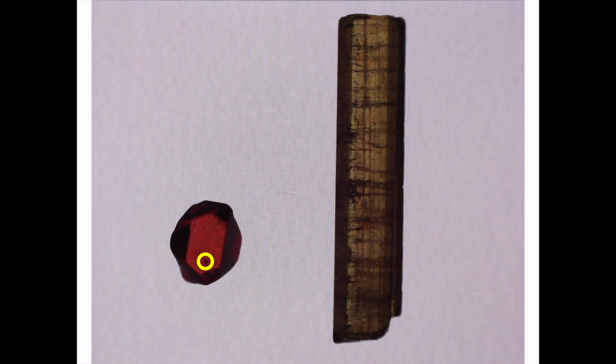So let's see if anything interesting happens when we spin our spinel crystal. And so as we rotate the spinel crystal in this plane, I want you to notice that not really anything's happening. We have this nice red color going on, and that's about it. I should also mention that all the crystals in the isotropic versus anisotropic kit are indeed natural, and in fact this spinel crystal also has an inclusion, and I'm not sure exactly what this inclusion is, but you can certainly see it right here in the crystal.